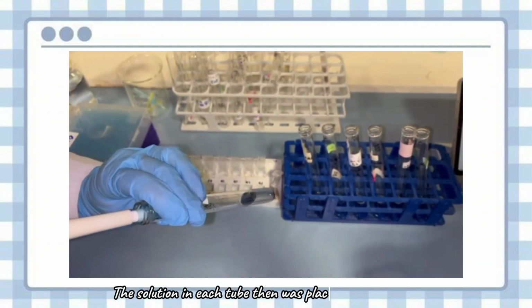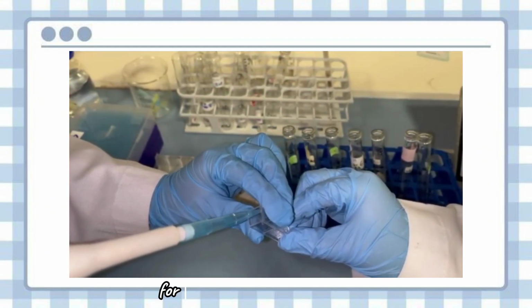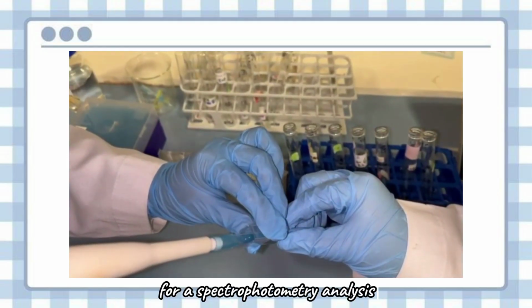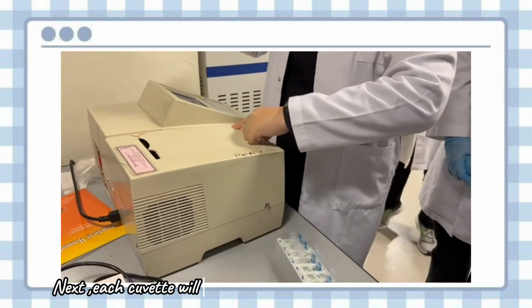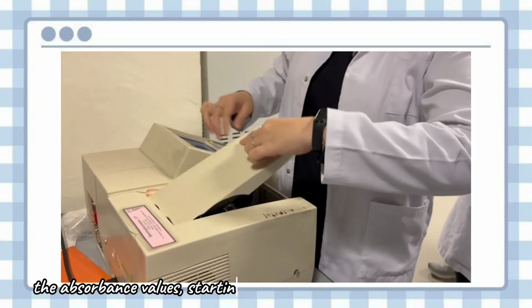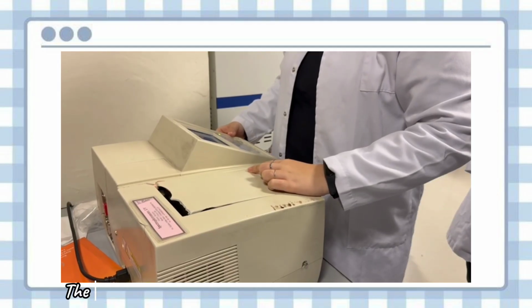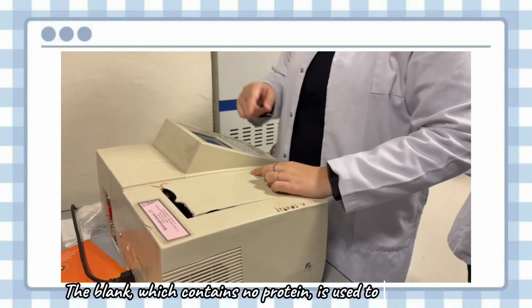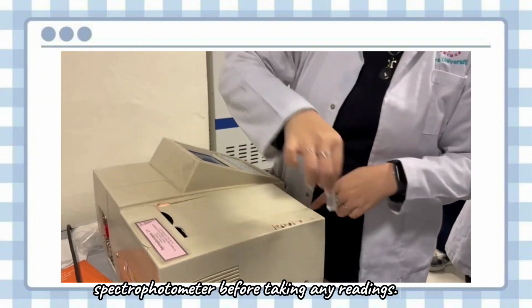The solution in each tube was then placed in a cuvette for spectrophotometry analysis. Next, each cuvette will undergo spectrophotometry to measure the absorbance values, starting from the least concentrated sample. The blank, which contains no protein, is used to zero the spectrophotometer before taking any readings.